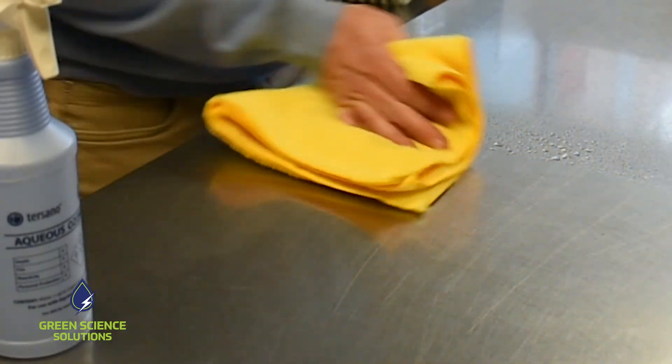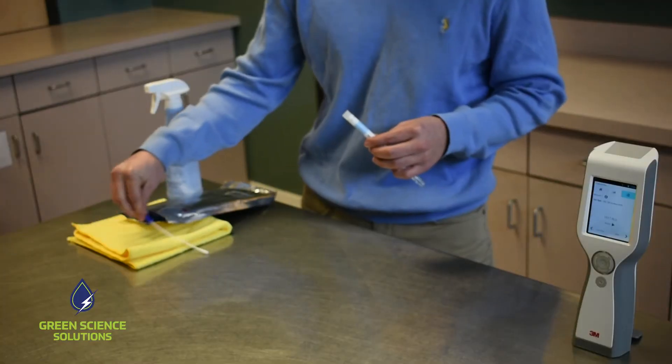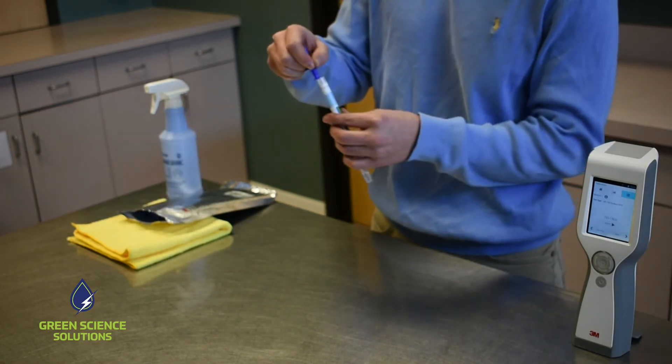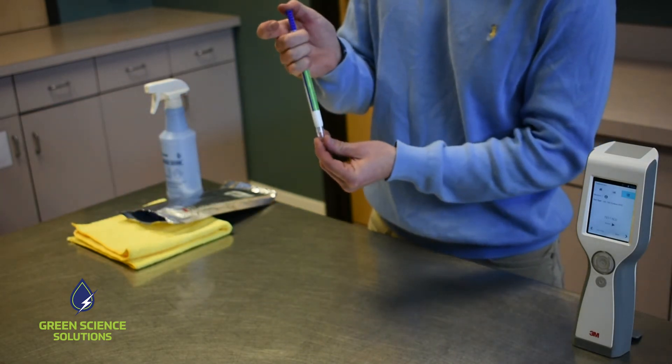Now, we repeat the process. We take a second swab and swab the area we just cleaned. Again, the swab goes into the solution and we shake it up.